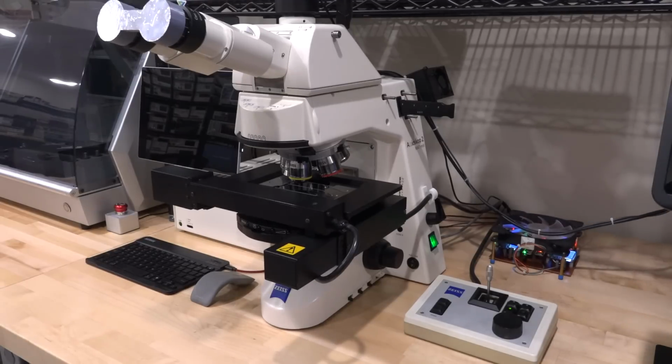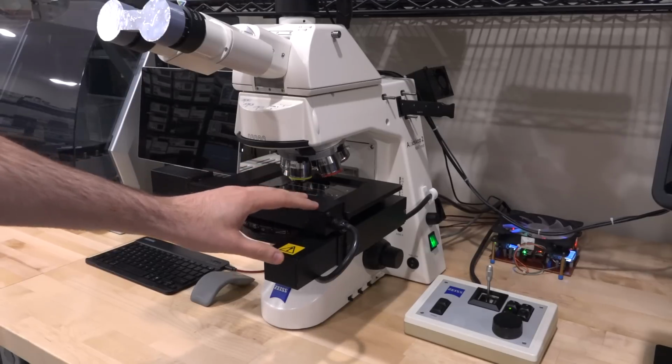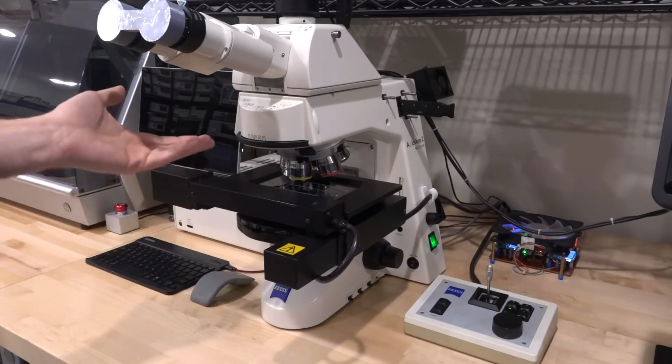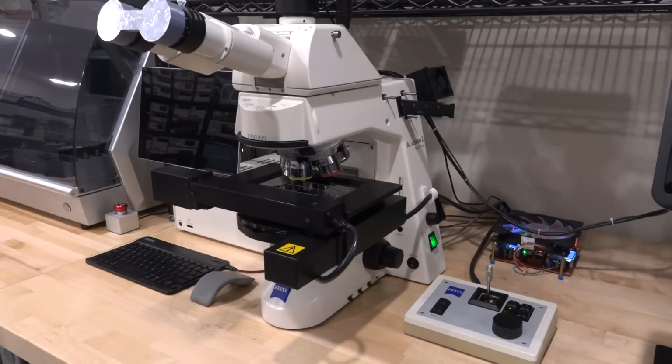We've looked at DIC microscopy, bright field and dark field and polarization, and a whole bunch of different interesting imaging techniques. Now in this video, I have upgraded the microscope to have an XY automated motorized stage. And of course, this has a motorized Z axis. And with the appropriate controller and some software that I've written, we can do Z focus stacking and XY image stitching. And this allows us to do a whole bunch of very interesting image captures that normally are not possible with a single capture of these microscopes. So let's take a look.